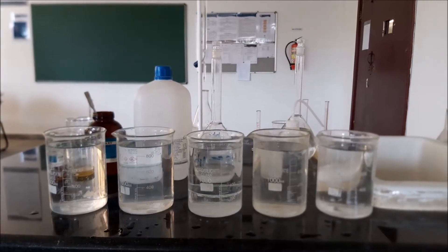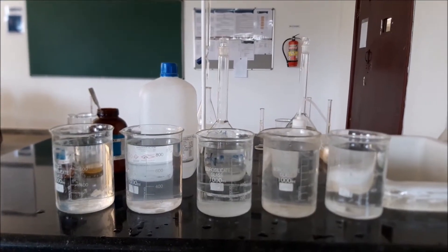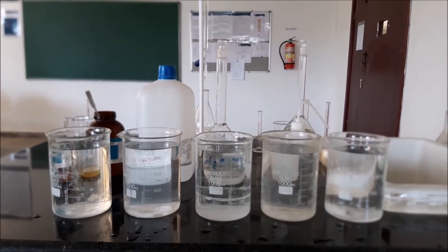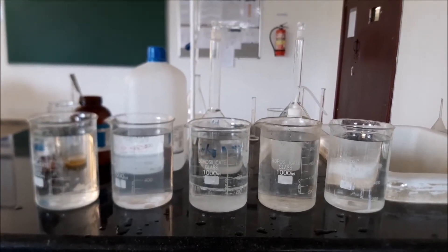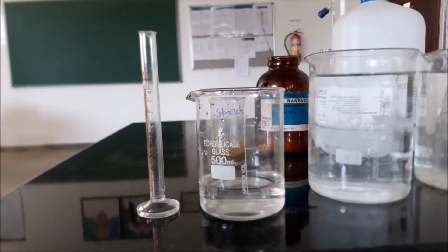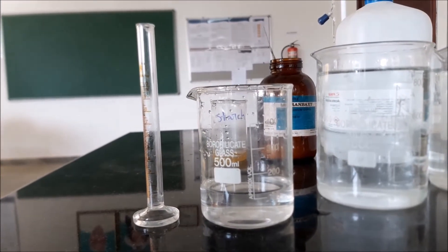Today we will be conducting a chlorine demand test. We have taken five beakers with a volume of one thousand ml of water each. Two, four, six, eight, and ten milligrams of bleaching powder is added to the respective beakers. This is the chlorine solution prepared by dissolving bleaching powder in it.